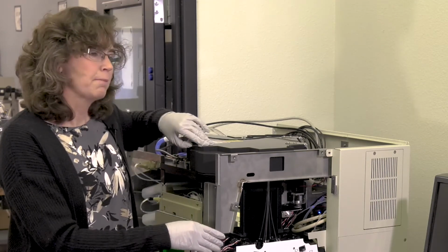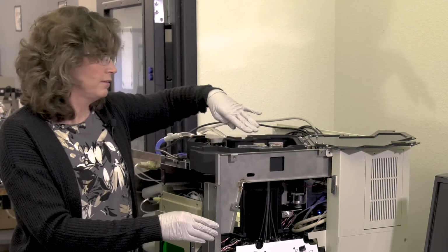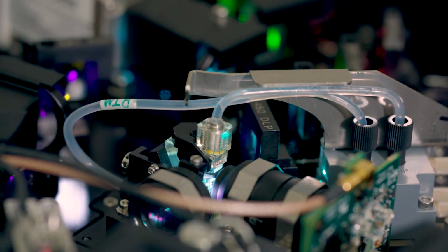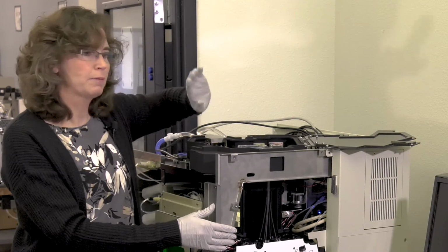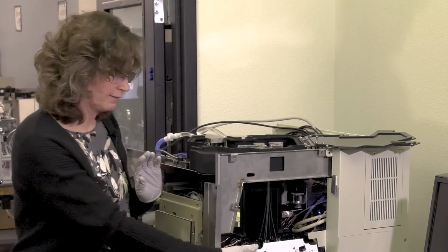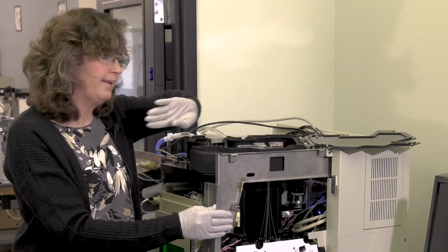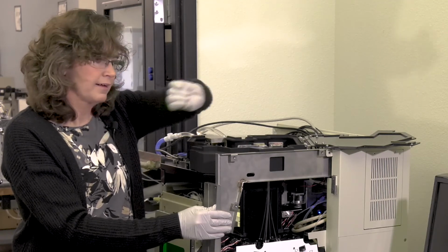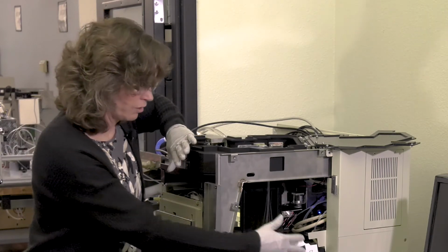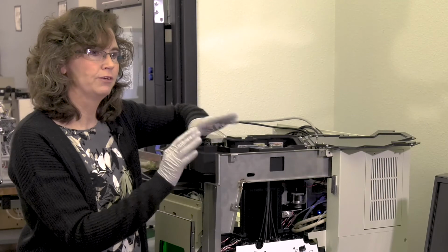That was done by the invention of something we call the ZE5i. It sits up here in the excitation area, but it is used primarily to create a signature for the LED spectrum for all of the detectors that are down here. Every wavelength that is detected in the detection area is represented by one or more LEDs on the ZE5i. It is simply a process and an algorithm to run through each one of those LEDs, look at where they appear on all of the detectors down here to know what the current configuration is and if the configuration has changed day-to-day.